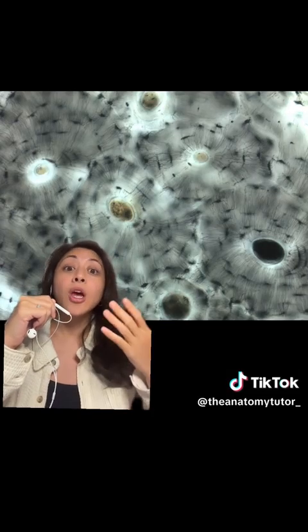Given that information, there are no fibers present in this picture, and what we have are patterns of calcified rings, and these rings make up larger units that are called osteons. And we can see that there's a unit right here, right over there, and like 3 to 4 more just around on this slide. In this picture, I've indicated where these isolated units are so that we could go in deeper as to who do we need to identify and what will you need to know for your next practicum.